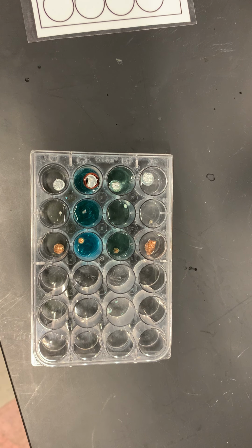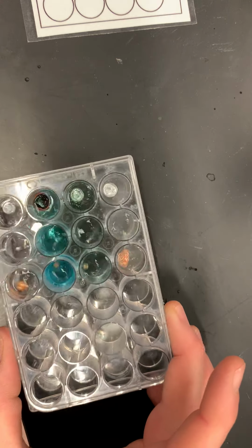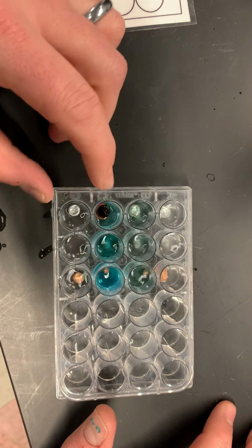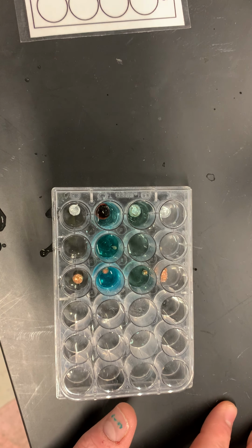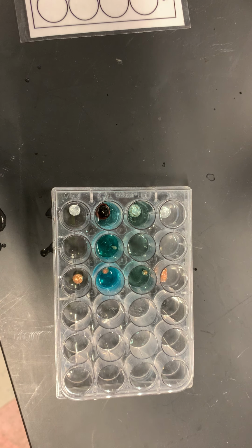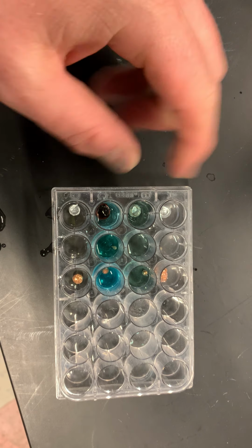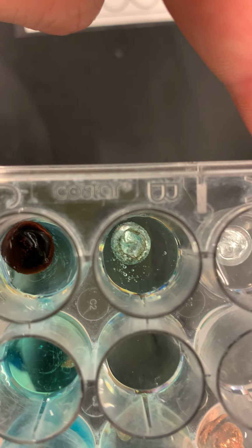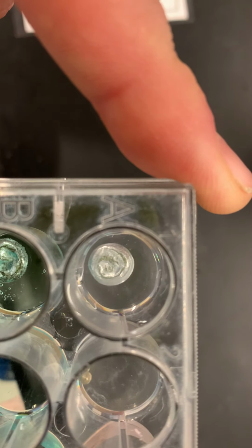Now this is basically something that we're going to record our observations almost immediately. The first thing that I see is in my combination of unknown number 1 and my copper chloride solution, I see that this has definitely had an impact on that solution. It's blackened, and I kind of see the same thing with solution B1, which is nickel sulfate. And there's definitely bubbles forming. It looks like it's getting a little bit black, whereas the first one, I don't see anything really changing there.